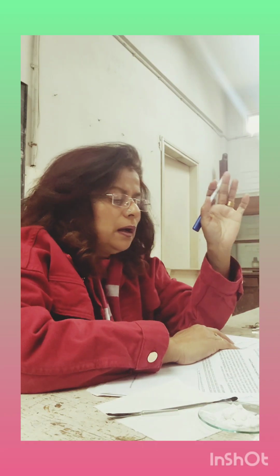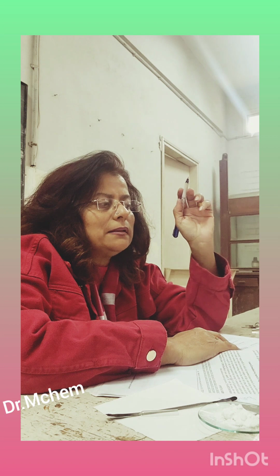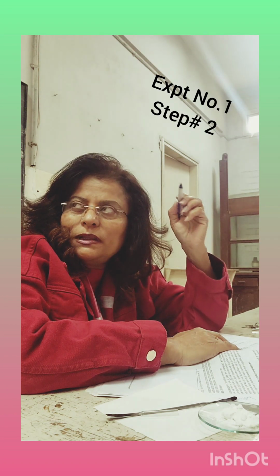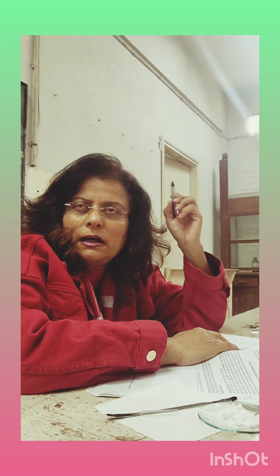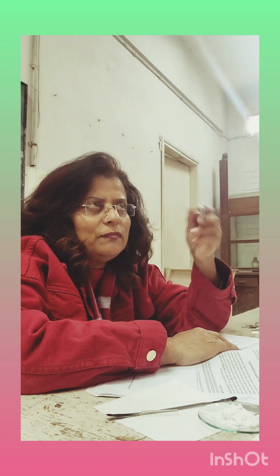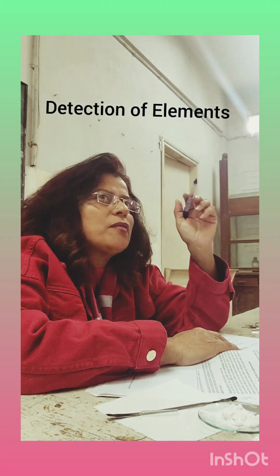So today is your experimental day now, and it's the same experiment, that is experiment number 1, but we are going to start with step number 2. Before the vacations, we were on step number 1. We have completed step number 1. Now we are on step number 2. And what is step number 2? It is detection of elements.